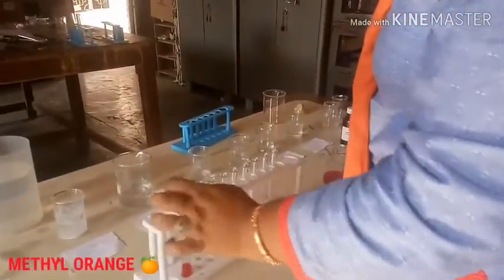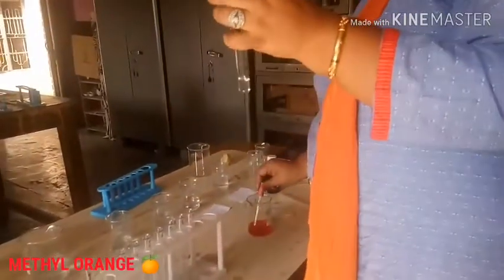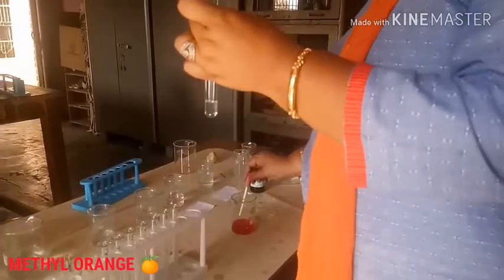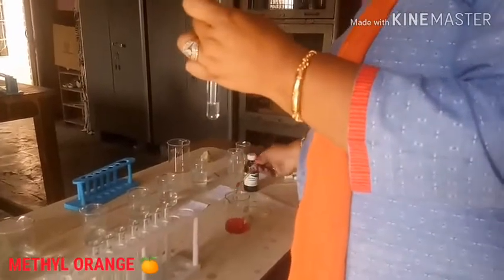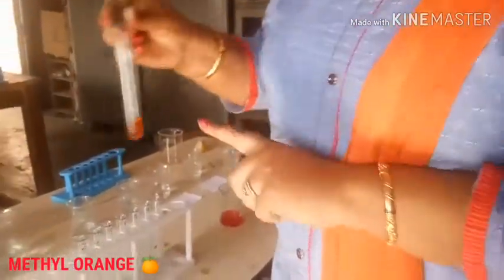Our next sample is sodium carbonate. It is a type of base. I am going to put two to three drops of Methyl Orange. It turns into yellow color in the basic medium — yellow in the basic.